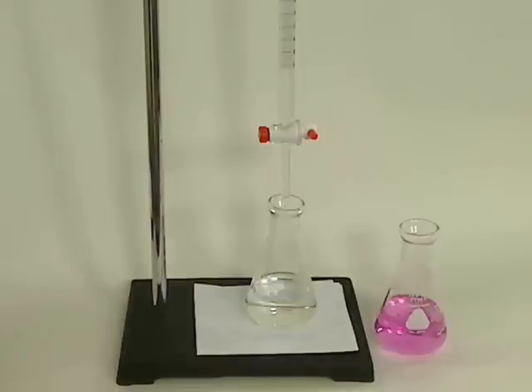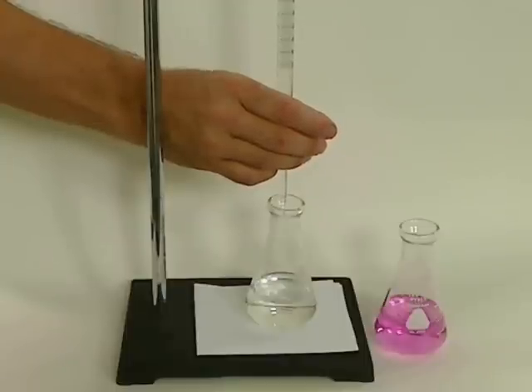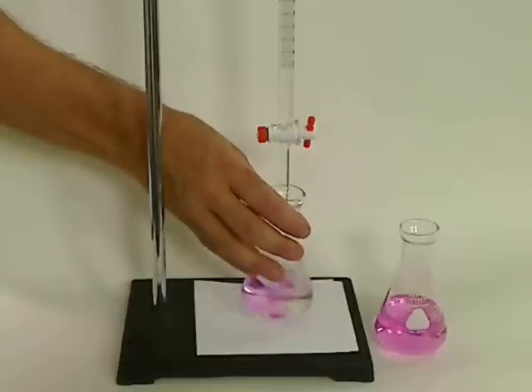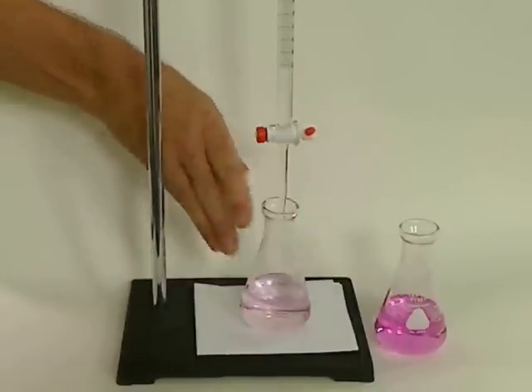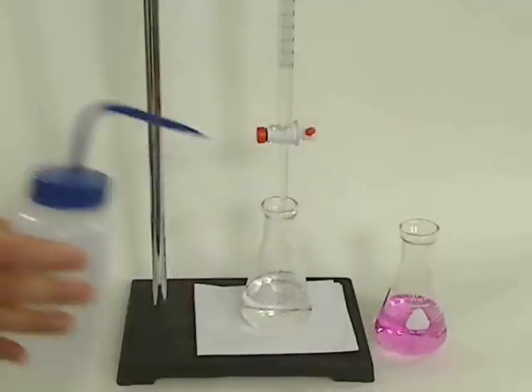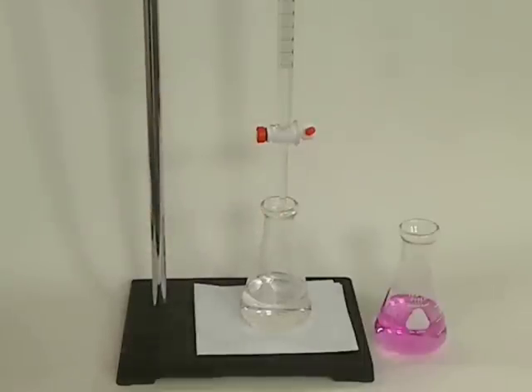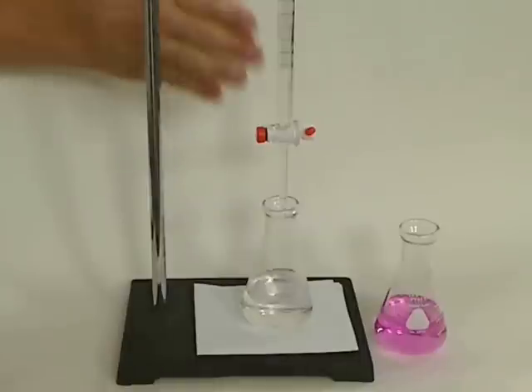I've done all of my rinsing and cleaning, and now I'm going to start adding a very small amount of base to my acid, drop-wise, until I start seeing those colors starting to stay just a little bit longer, and then swirl. I also want to continue washing the sides of my Erlenmeyer flask. You want to use an Erlenmeyer because you want to make sure everything from the burette goes into it. I also want to make sure the tip is inside the Erlenmeyer flask.